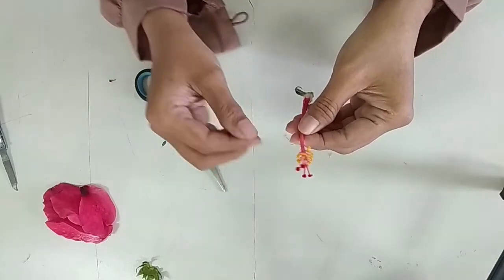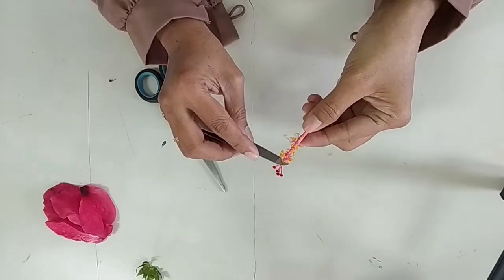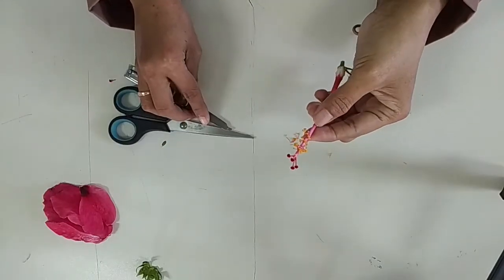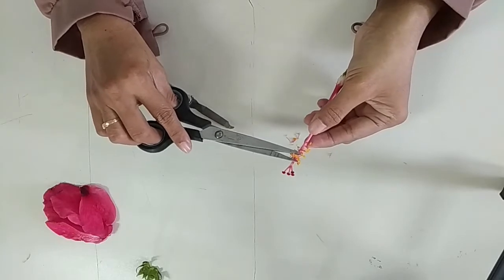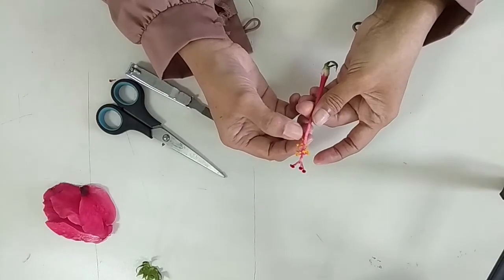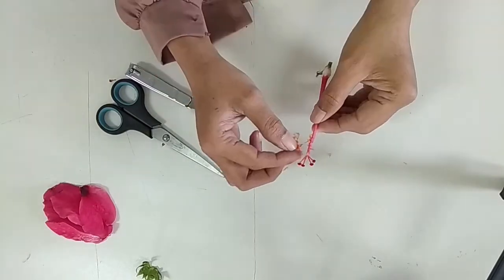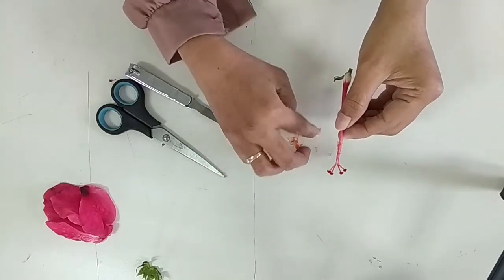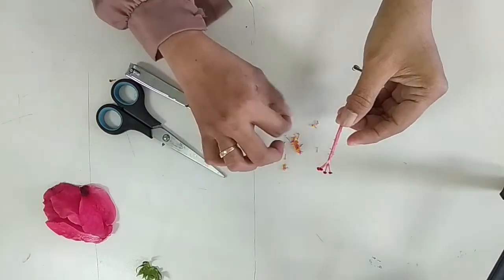The stamen is where the pollen is produced. Be very gentle because the anther is very small and fragile. Inside, you find pollen and pollen grains. The pollen is what fertilizes the flower ovules, which allows it to reproduce. Winds blow the pollen from the flower that's producing it to another flower.